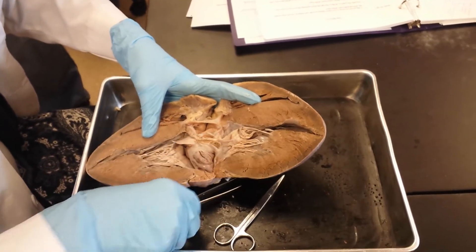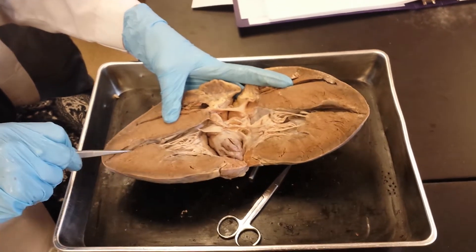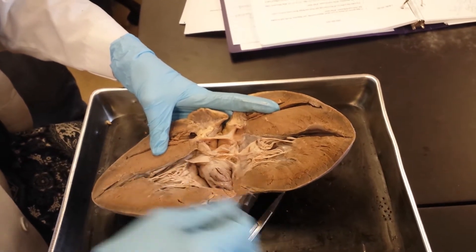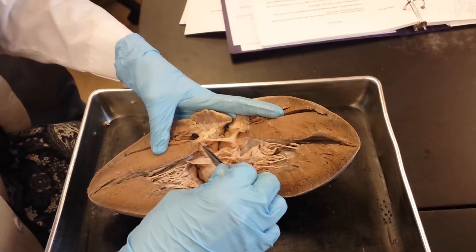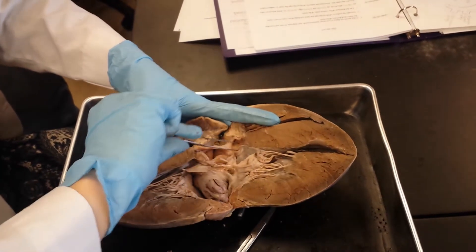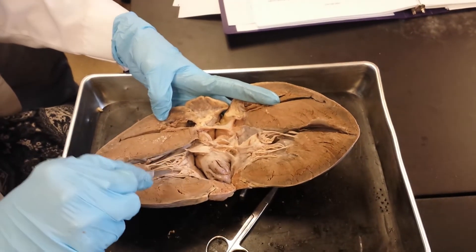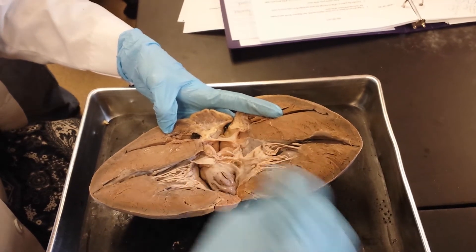Two more valves I want to show you. On the inside here, between the left ventricle and up through the aorta, this is going to be your aortic semilunar valve — you can see part of it right there. So we've now gone through the bicuspid valve, tricuspid valve, and aortic semilunar valve.